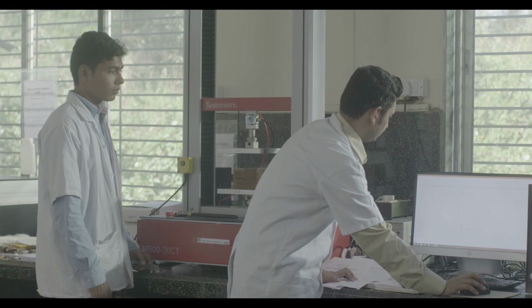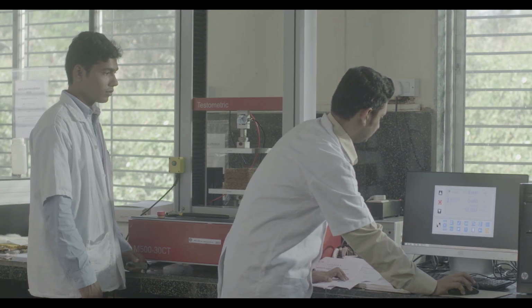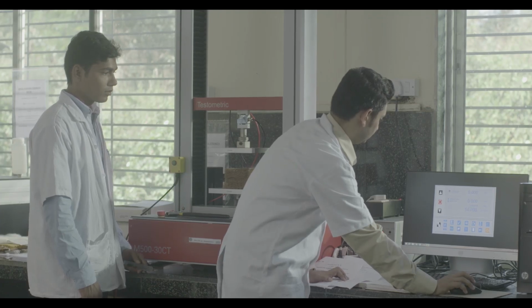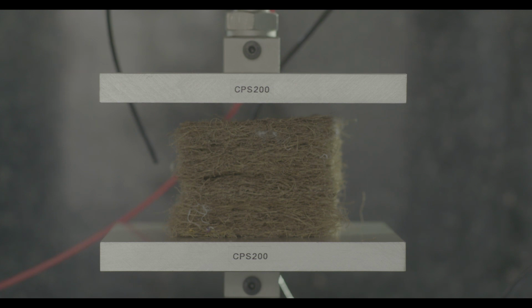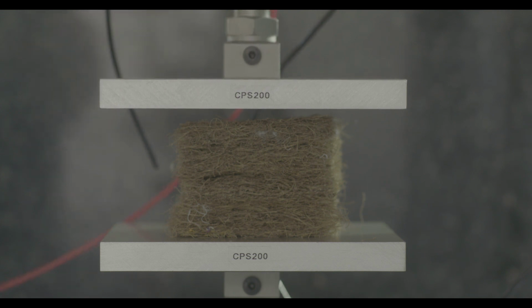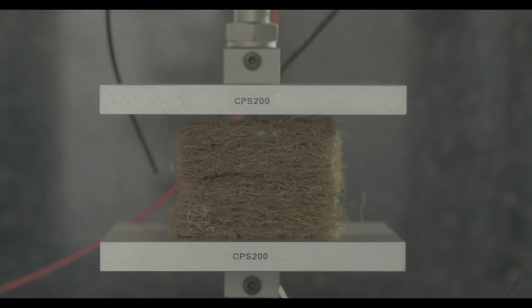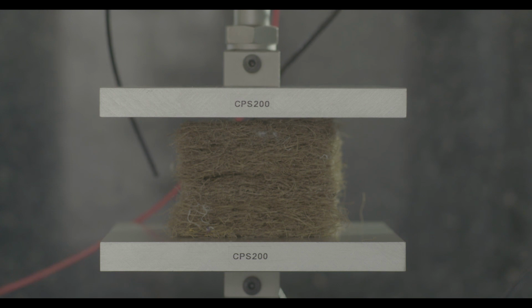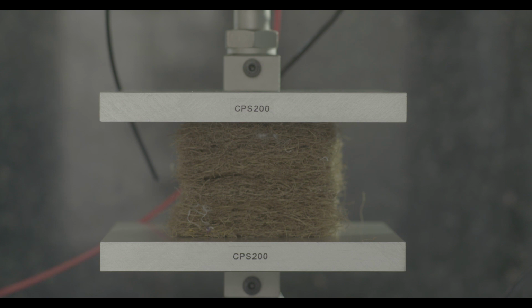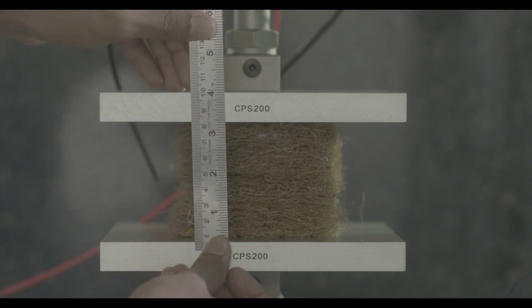Select the compression test option in the software and set the required speed, for example 50 mm per minute, of the movable upper compression plate. Then start to lower the upper compression plate and stop when it just touches the upper part of the specimen. At that time, measure the thickness of the specimen, T, in millimeters. Alternatively, thickness can be measured after conditioning of the specimen.